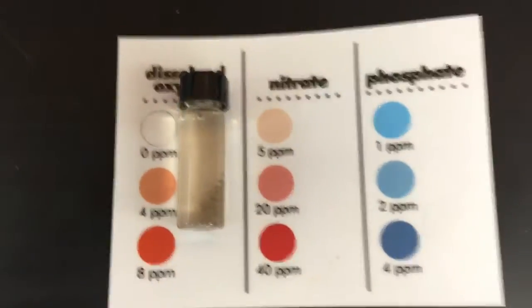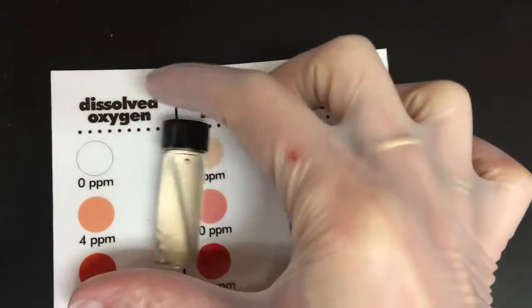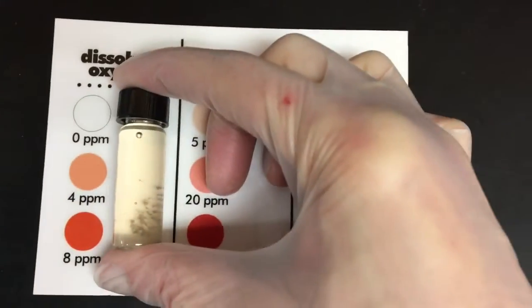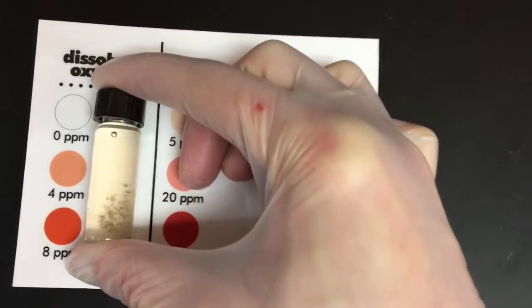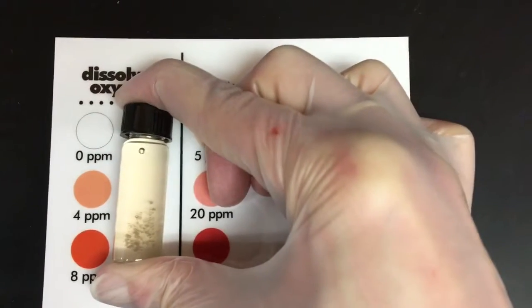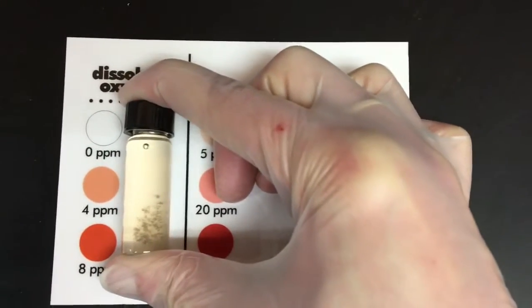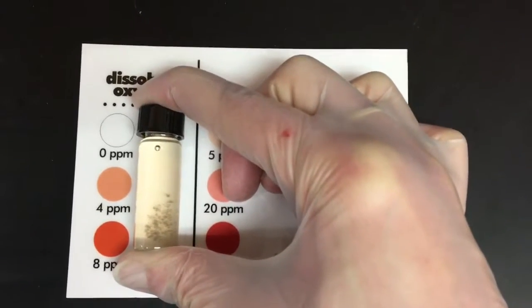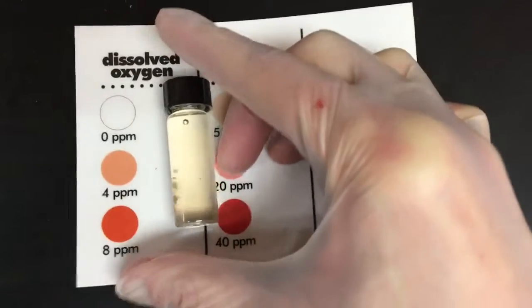If we look at the dissolved oxygen card here — it's really kind of hard to see — it's not quite zero, it's not perfectly clear, and it's definitely not 4. So we would say that the dissolved oxygen in this water sample is between 0 and 4, and we'll say this one is about a 2.